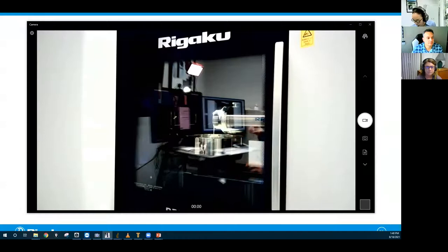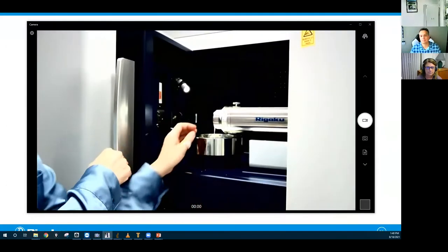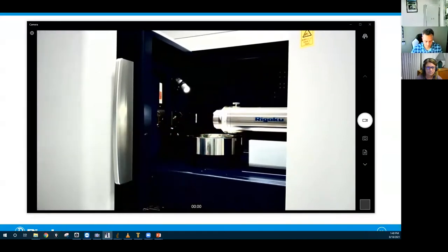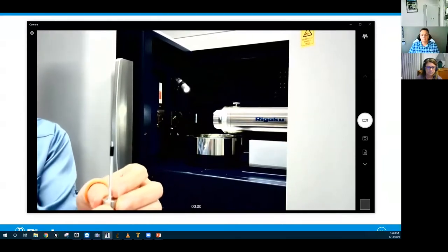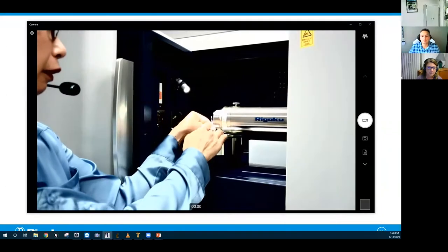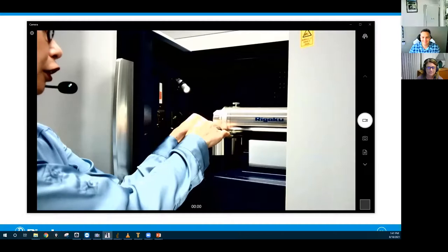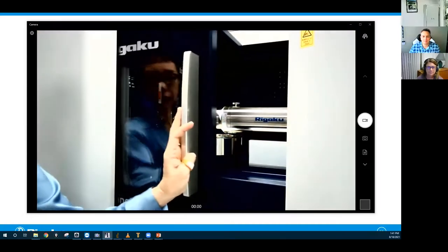So let me take this earplug out. And I'm going to put the polymer sheets. I guess you can't really see this, but yeah, it's a little out of focus and a little small. Well, you saw it under the microscope. You will see it again from the CCD view.